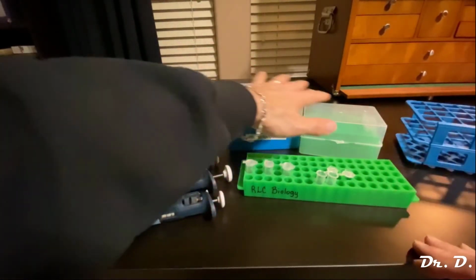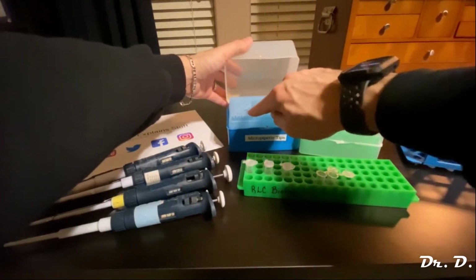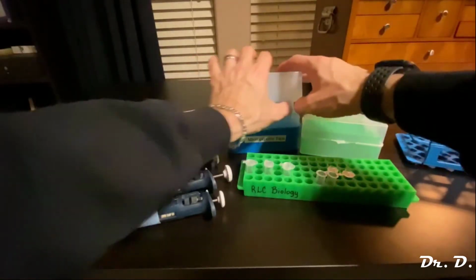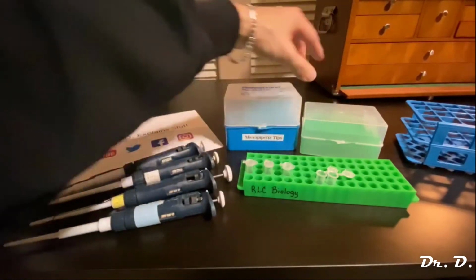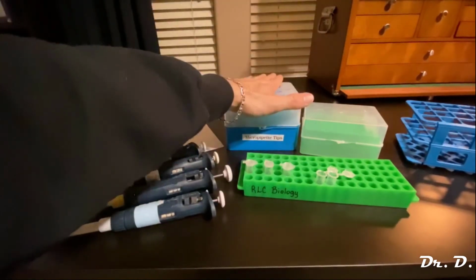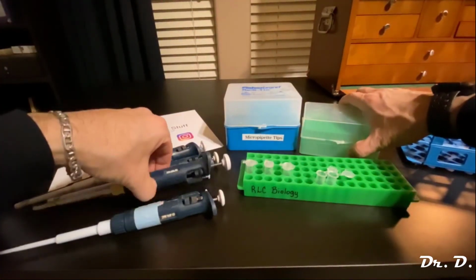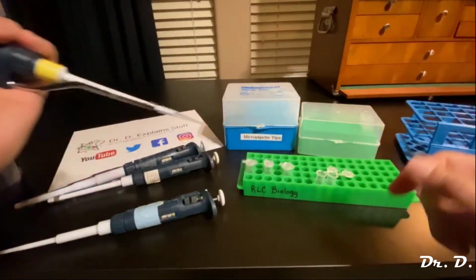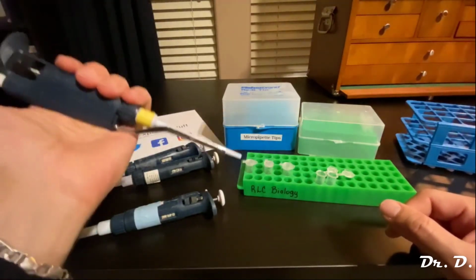By the way, these tips are not autoclaved, but if they were, I would want to make sure not to touch them because they would be no longer sterile. Okay, so just be aware of that. A lot of times you'll see autoclave tape on top of these boxes, and that will show you that the tips have been autoclaved and they are sterile. If the tips are autoclaved and sterile, then you want to be really careful and quick when you grab your Pipettemen, set it to the right setting, open it up, grab your tip, and you're out, and you close the top. You make sure not to touch the tip anywhere. If you touch the tip anywhere, it's no longer sterile, and you might as well eject it.